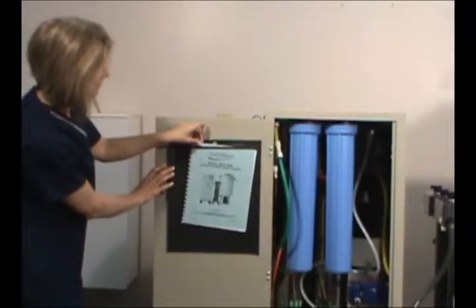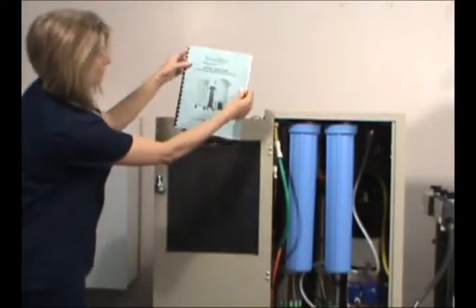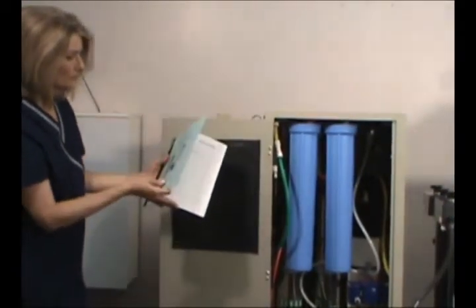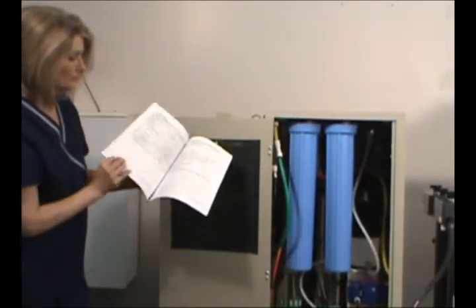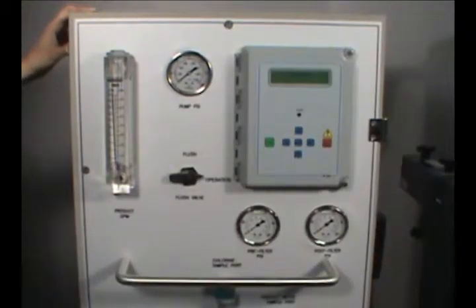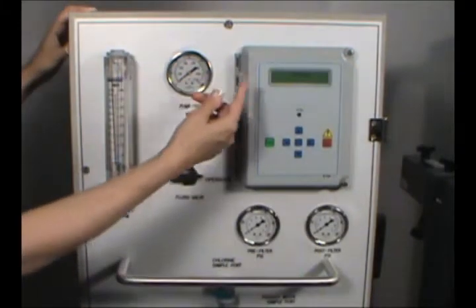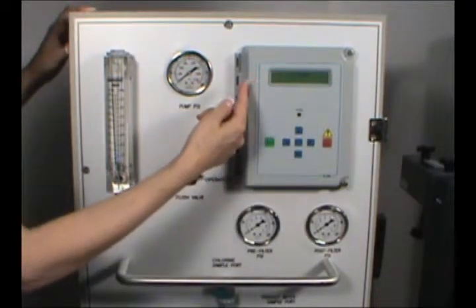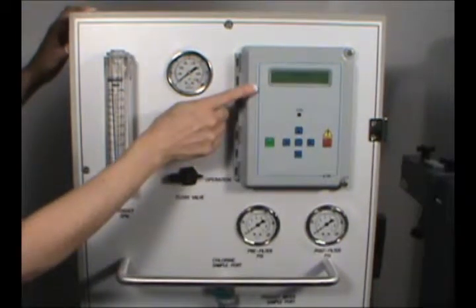This handy manual inside the door contains complete instructions for installation, operation and maintenance for all three high quality water treatment units. The RO has several meters and gauges for effective monitoring. The first is called the controller, which has an LCD readout of the rejection percentage, conductivity, temperature and hours of operation.